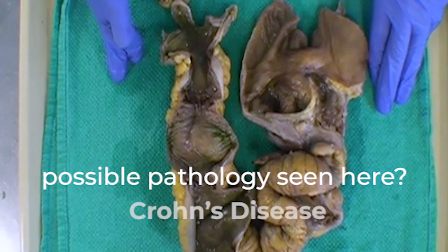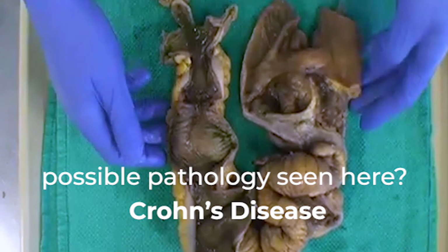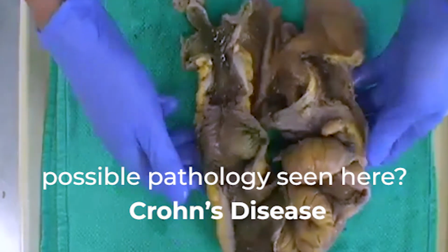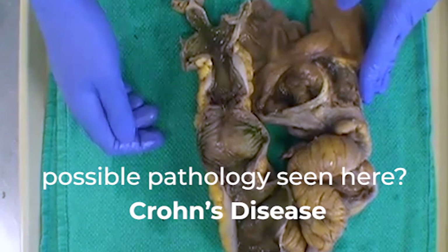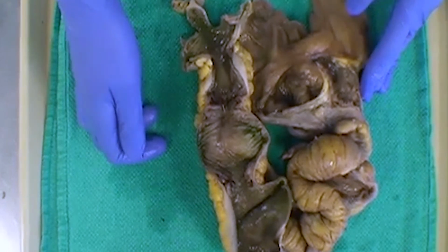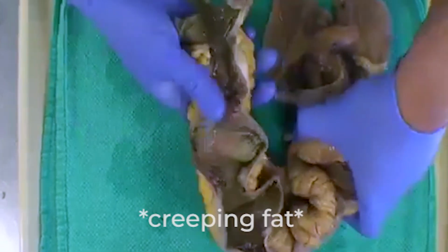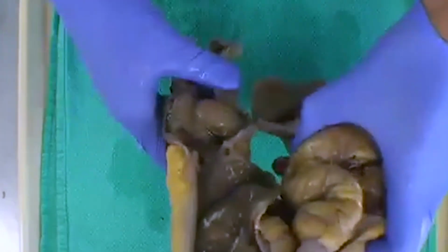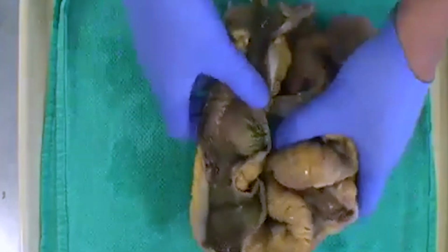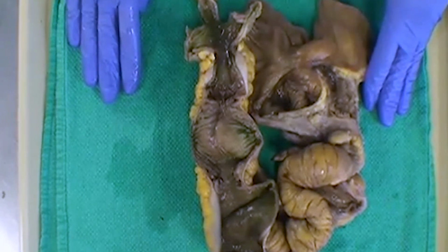Okay, perfect. So we have Crohn's disease. Yeah, that is correct. As we talked about in a previous gross rounds, there is a differential for strictures in the small bowel, but certainly the most common in this population would be Crohn's disease. And we have a mention of creeping fat as well, which is perfect, is when you get the fat going full 360 degrees circumferential around the entire bowel. So perfect. By the history, this is a case of Crohn's disease.